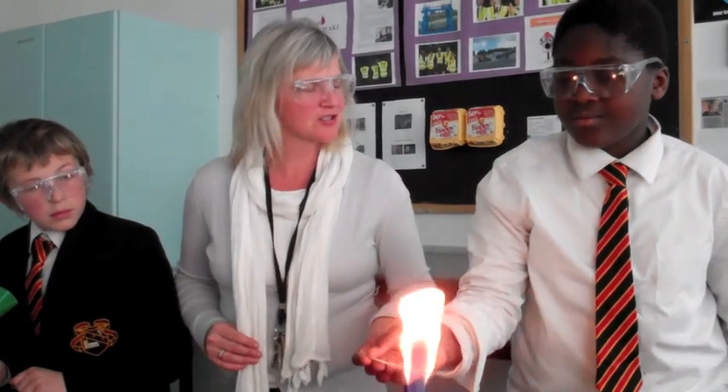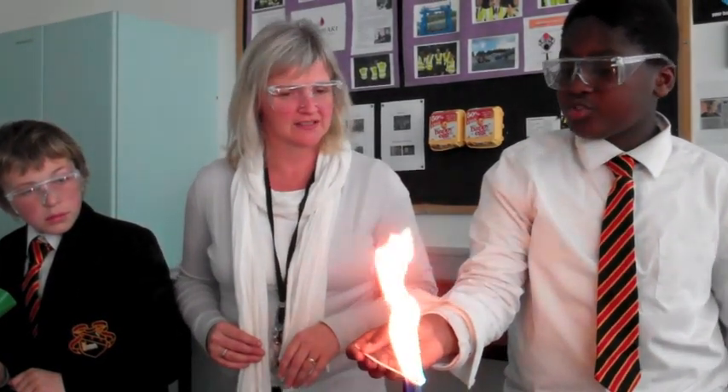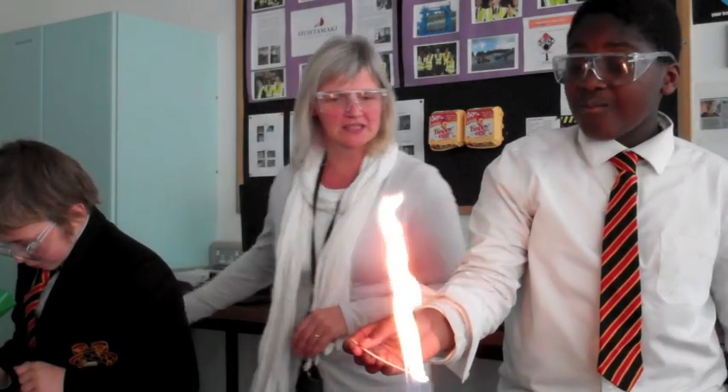What was the description of your flame colour, Barium? Green and blue. There, you write that down.